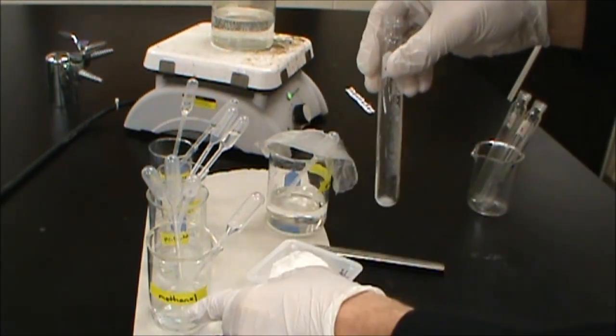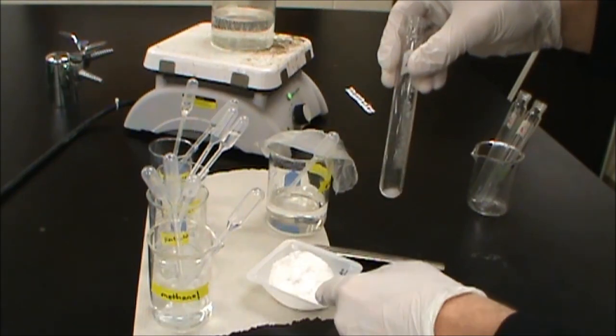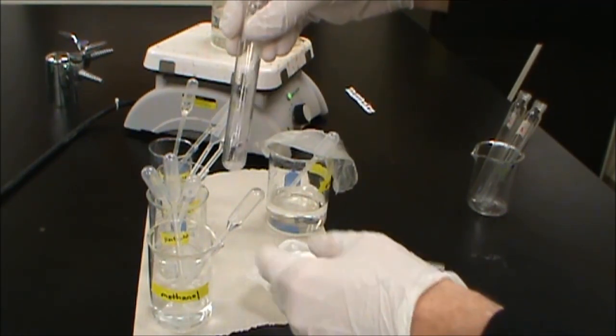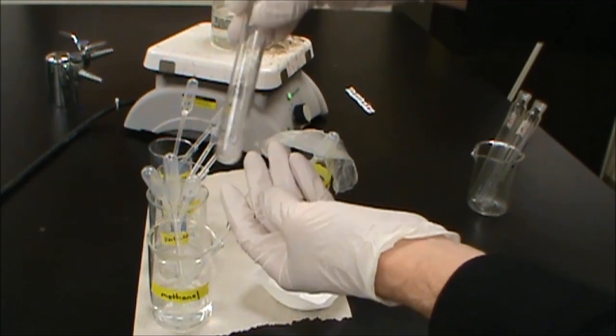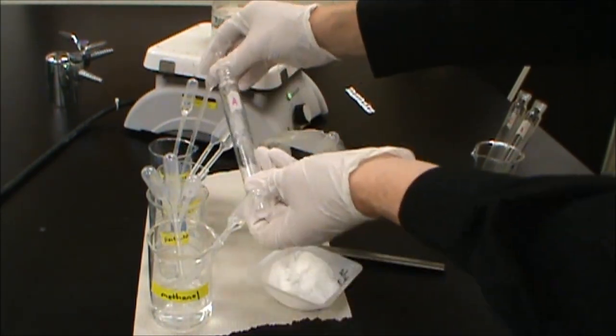Esterification reaction is always going to be an alcohol, in this case we have methanol, mixed with a carboxylic acid, in this case salicylic acid. Then we need an acid catalyst to get this to react. So we're going to add two drops of sulfuric acid.